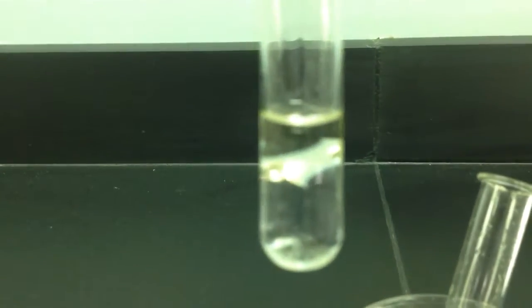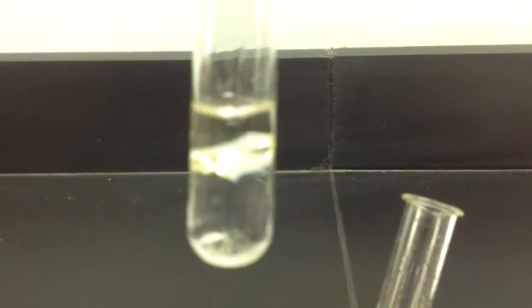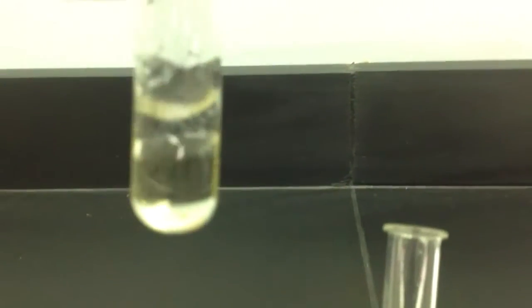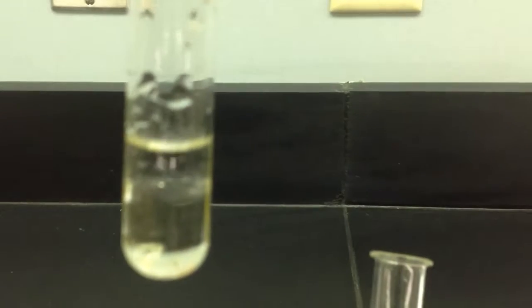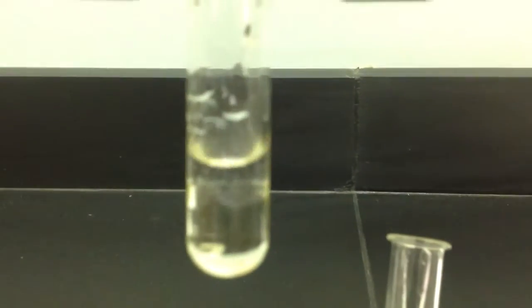In both cases, we see the formation of layers. This shows that the polar solvent and the non-polar solvent are immiscible in each other. There's water and our non-polar solvent, and there's ethanol and our non-polar solvent. We see formation of layers, which indicates that the two are incompatible with each other.